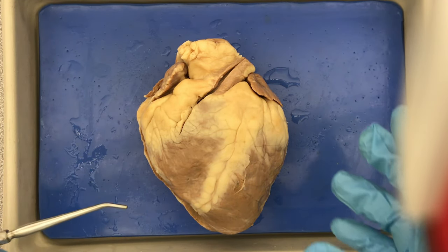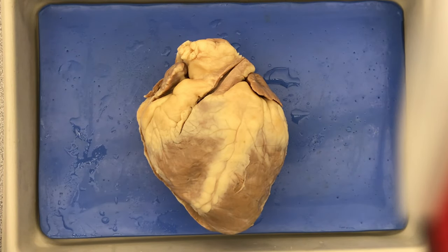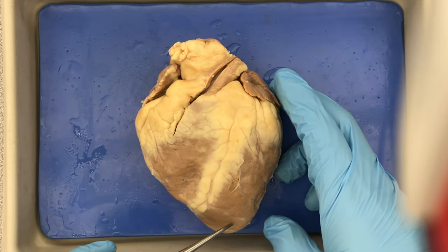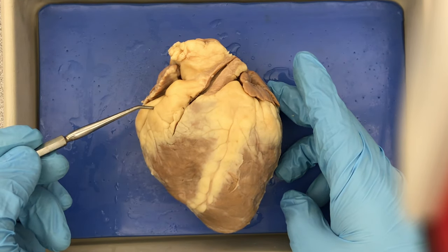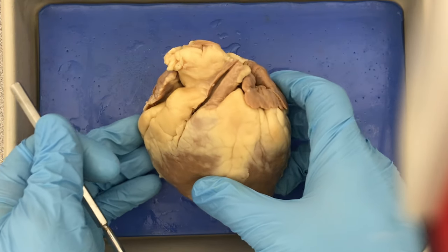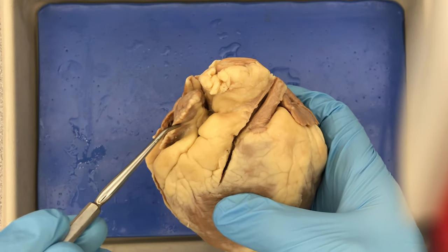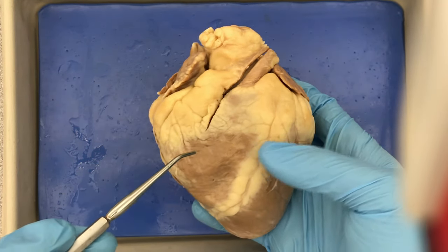This is a demonstration of the anatomy of both the sheep heart as well as the human heart model. The apex is at the bottom, and across the top is the base. You can see that there is an auricle here — this little pouch that fills up when the atria fill up — and here's the other pouch. These are the auricles.